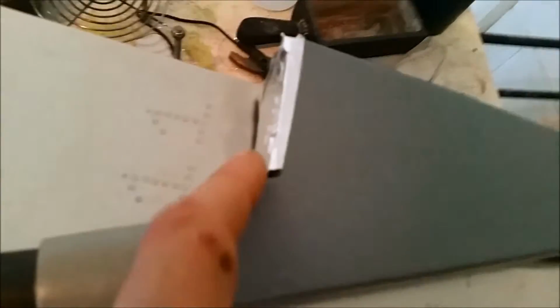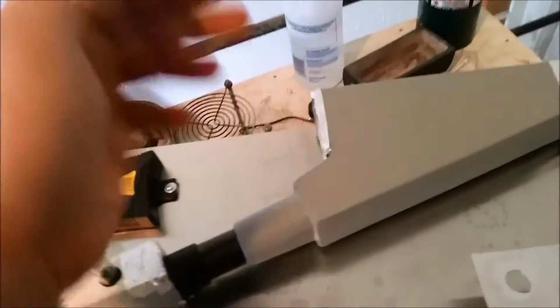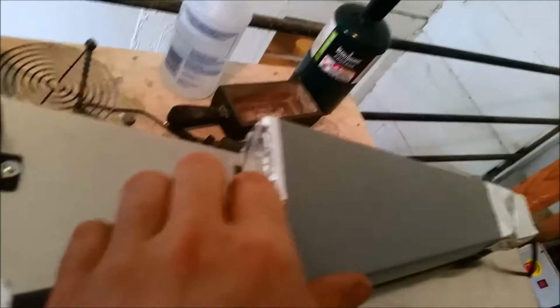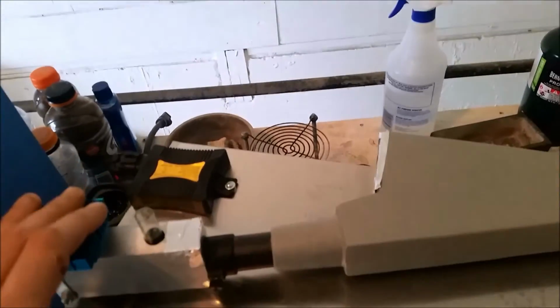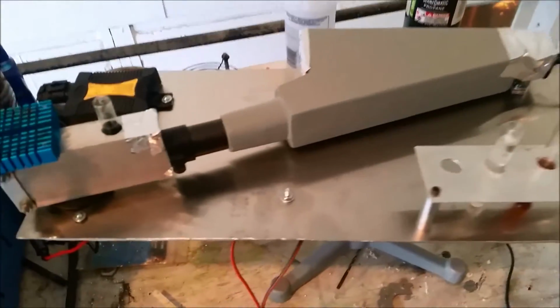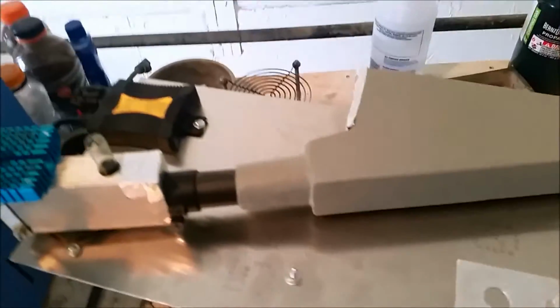I've got the scale taped off. It was good to use to calibrate the system with, but after that the lines in the scale can start giving you false readings, so it's got to be covered up past that. You'll notice a lot of this, I use this aluminum foil tape. It is awesome. It doesn't let any light through, and I pretty much keep it on hand just as much as I do duct tape or electrical tape because it's just that useful.